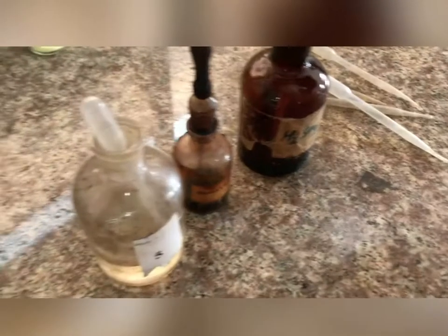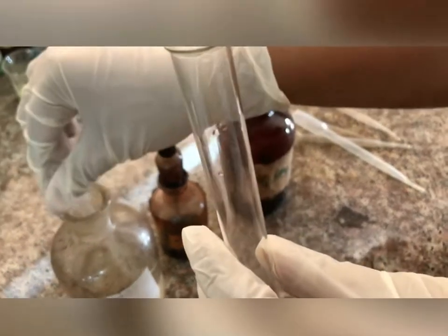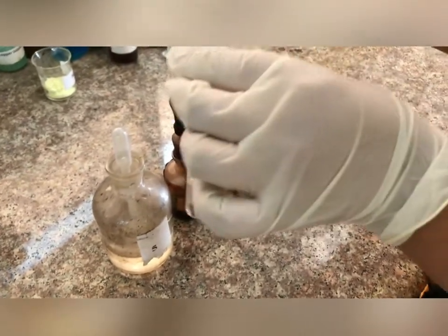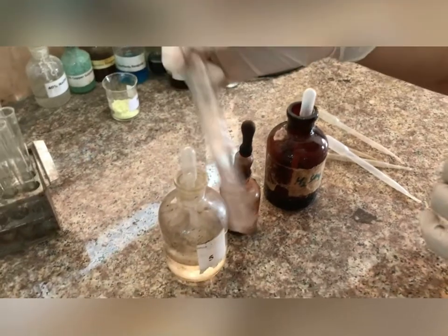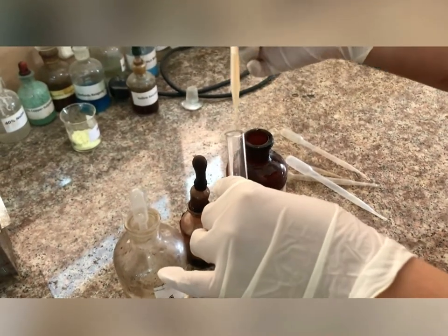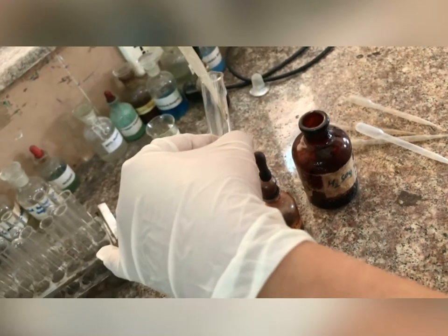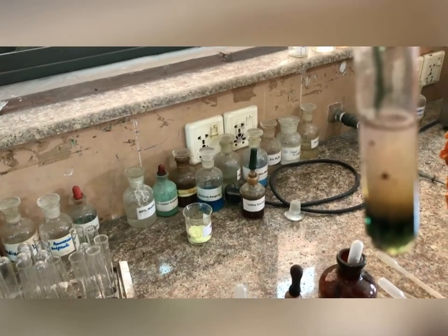Now we will perform the Molisch test to detect the presence of carbohydrates in a given solution. We will take 3 ml of sample solution in a test tube, then add four to five drops of Molisch reagent and mix it. Then add 3 ml of concentrated sulfuric acid along the walls of the test tube, which should be tilted. The formation of a purple ring at the junction of the two liquids indicates the presence of carbohydrates in the given solution.